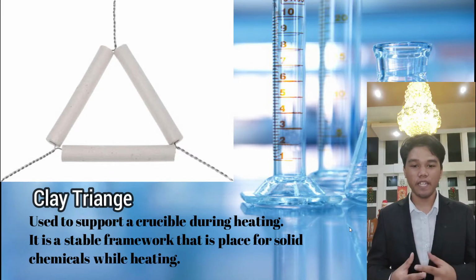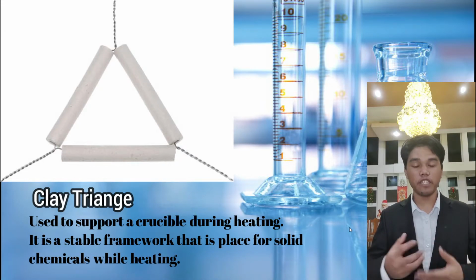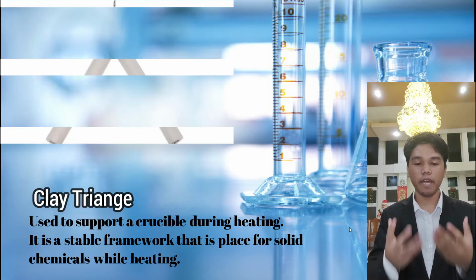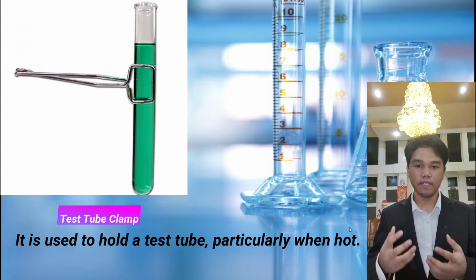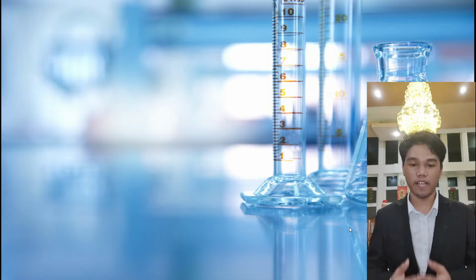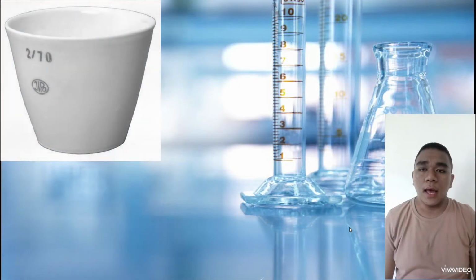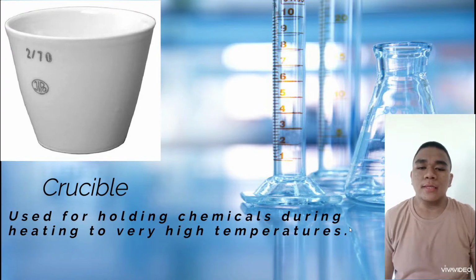Or in other words, it is a stable framework that is placed for solid chemicals while heating. Next is test tube clamp. It is used for holding a test tube. Crucible is a small utensil for conducting high temperature chemical reactions and analysis, or large industrial vessels for melting and calcining.